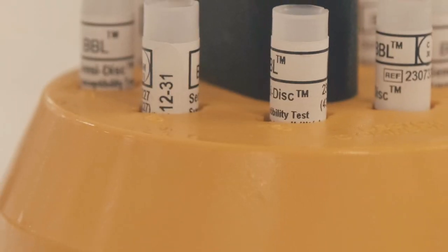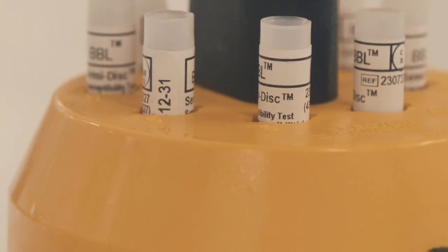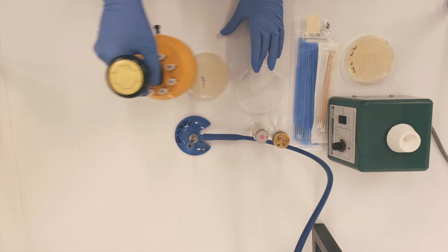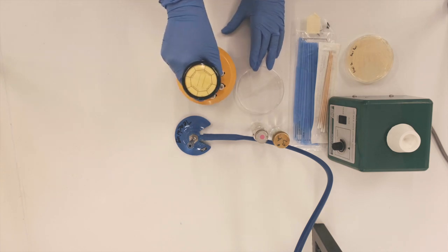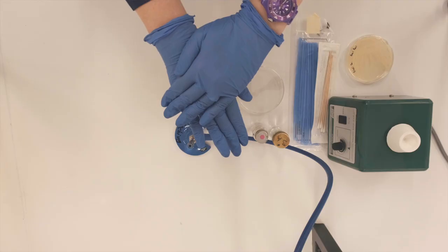Antibiotics can come in different formulations — tablets, drops, creams, or liquid suspensions are all quite common. For this type of testing, we can use antibiotic disc dispensers to add many different antibiotics all at once to our testing plate. Simply place the dispenser over the plate and press down gently.